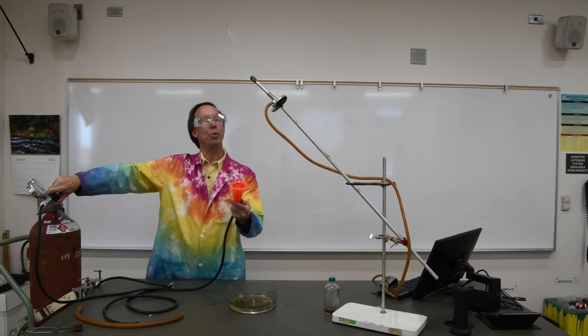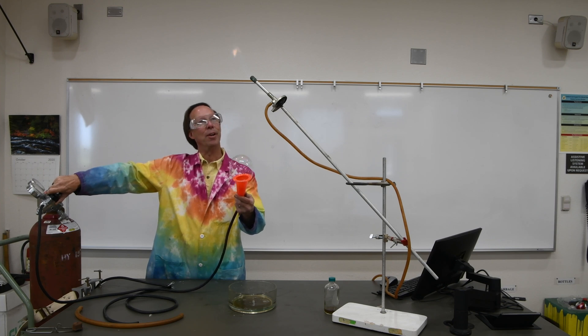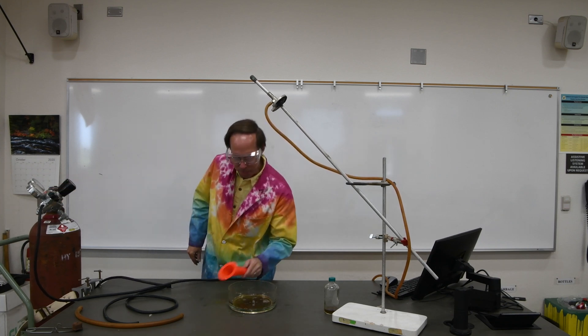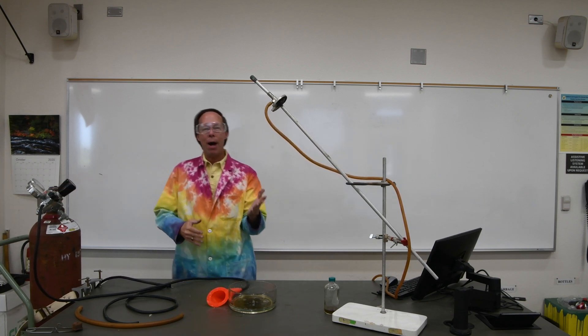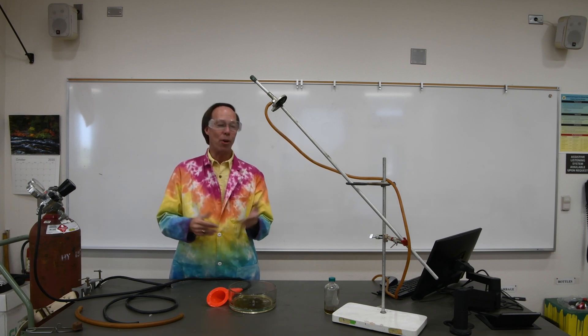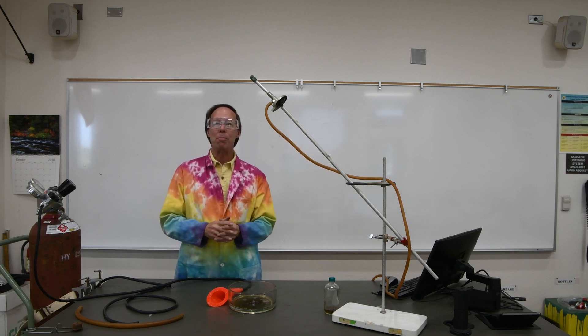Well, we missed that one. Hydrogen bubbles do move fast. Now normally I would have someone in here helping me. They would be holding this torch and chasing the bubbles but I'm going to have to try to do this on my own here. Whoa, that was a good one! What happened there is the bubble popped on the way up, it mixed with some oxygen in the air, made it a much more explosive mixture.